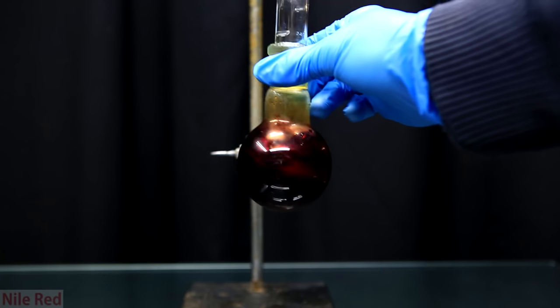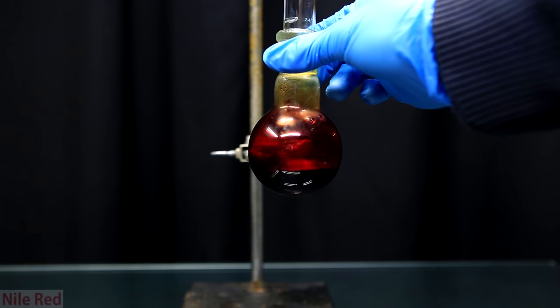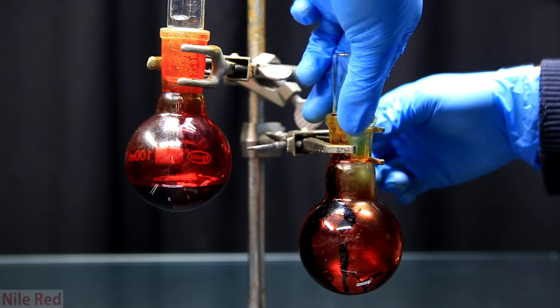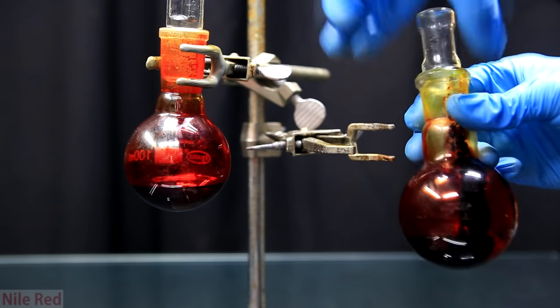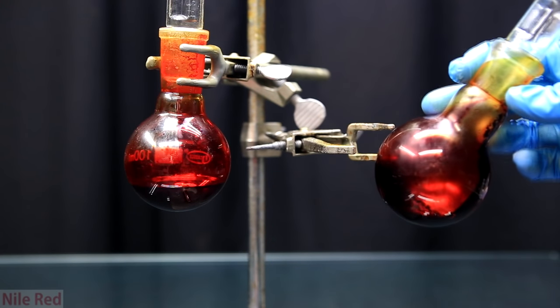After I let it sit out for a bit, I shook it around, and you can see that there's some solids in there. I really didn't like this, so I decided to clean it up a little, and I transferred it to another round bottom flask and left all the solids behind.